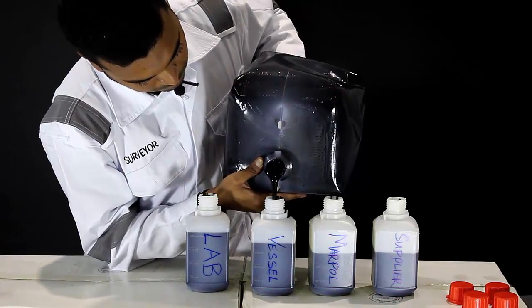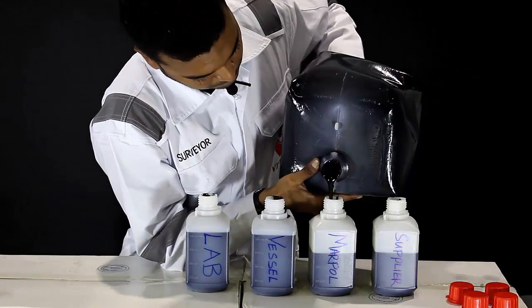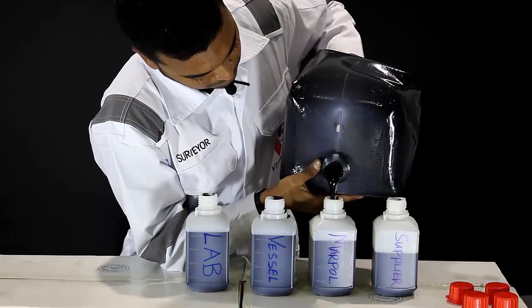After this, the sample bottles are full and can be closed.